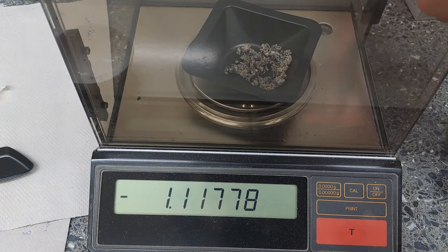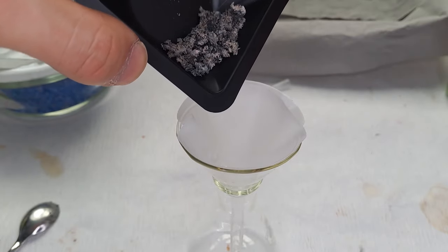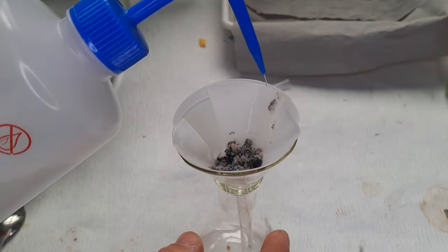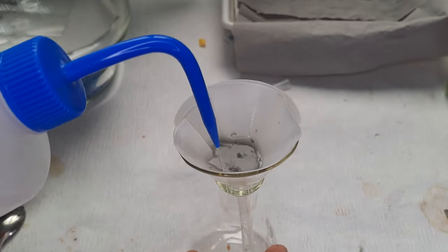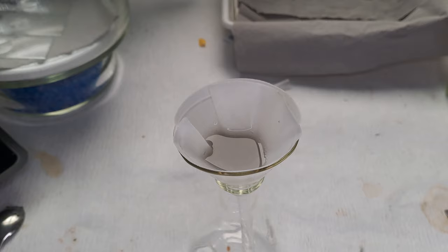The total ash weighs now only 2.5 grams. The ash will be washed and filtered in the hopes that the filtrate contains all of the potassium as dissolved potassium carbonate. Potassium carbonate was formerly known as potash, so it's in the name of the compound that you can obtain it by incinerating plants.